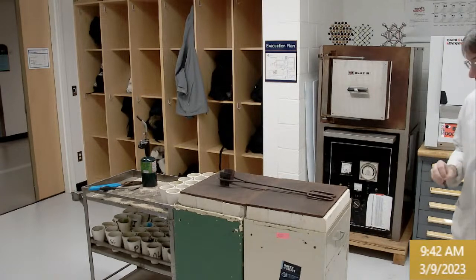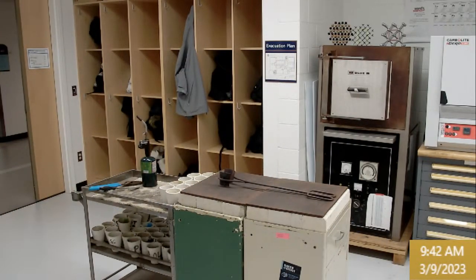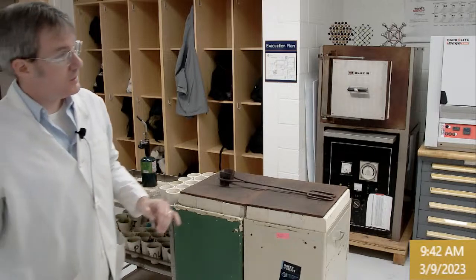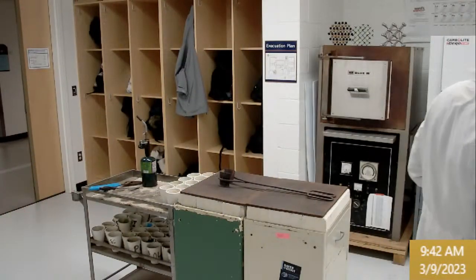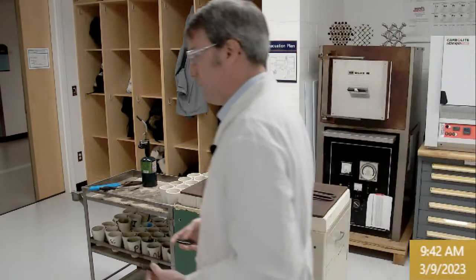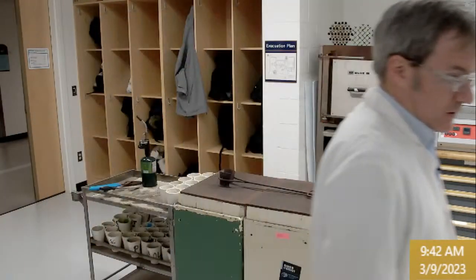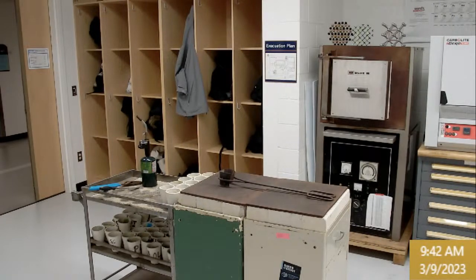That way, after it cools, we'll still be able to tell what the compositions are because we'll have lots and lots of glass pieces. And so we can see this one is 3i. So that we know this batch is that one on number 9 there, and we know exactly what's in this. That's a low cobalt oxide glass, 3i. Otherwise, I'd have no idea what all these pieces of glass are. So that's why the stamp is there. So that's already set up for the first one.